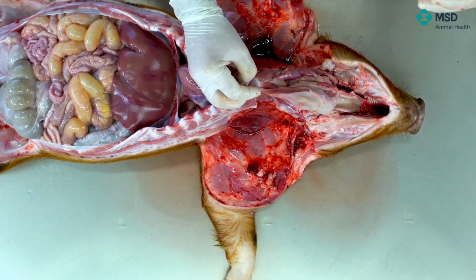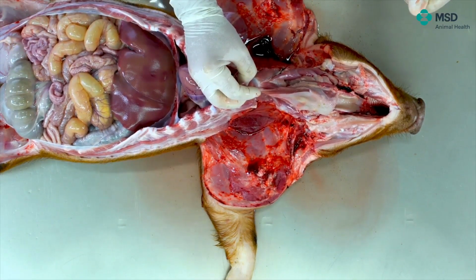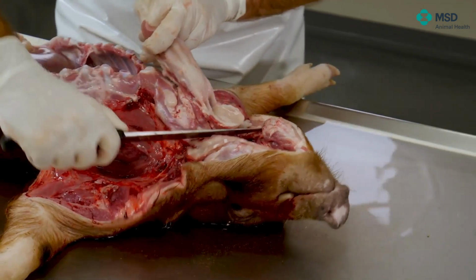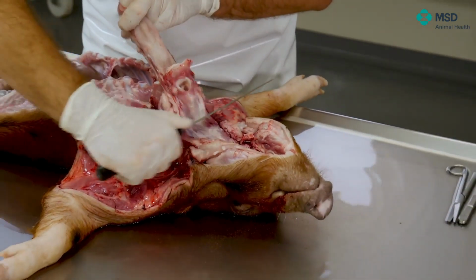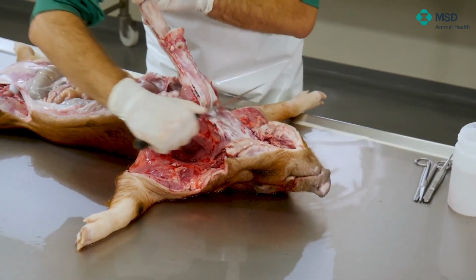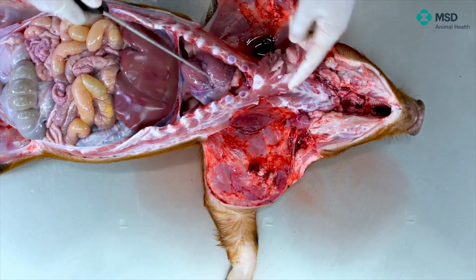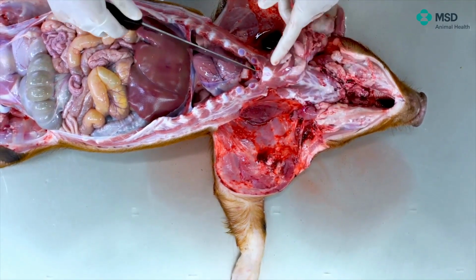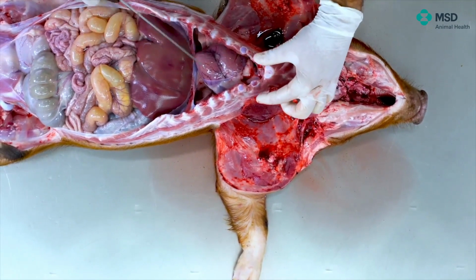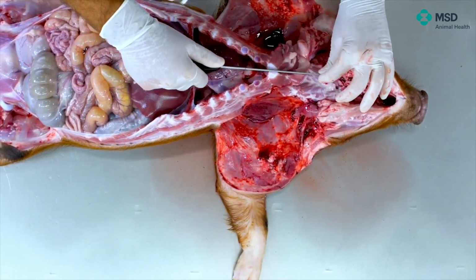So what we are doing here is to remove the tonsil together with the tongue. And then we are just separating in a careful manner the trachea, the esophagus, and I'm just progressing towards the thoracic cavity. The way of opening the thoracic cavity is relatively easy in a small animal because at the very end the joint between the two thoracic walls is cartilaginous, so I can cut very easily that way.